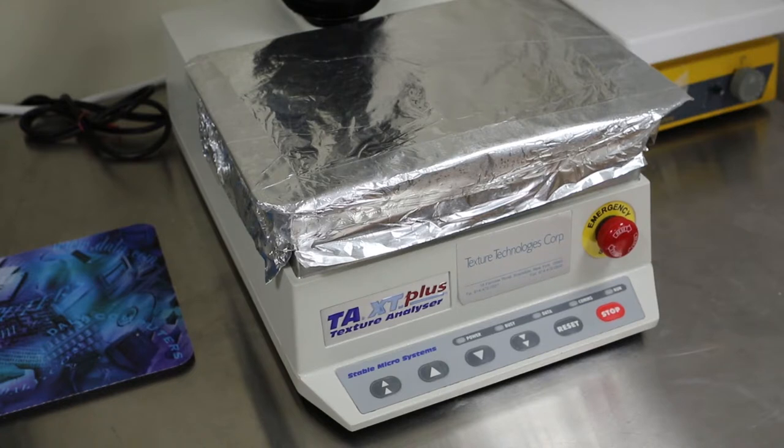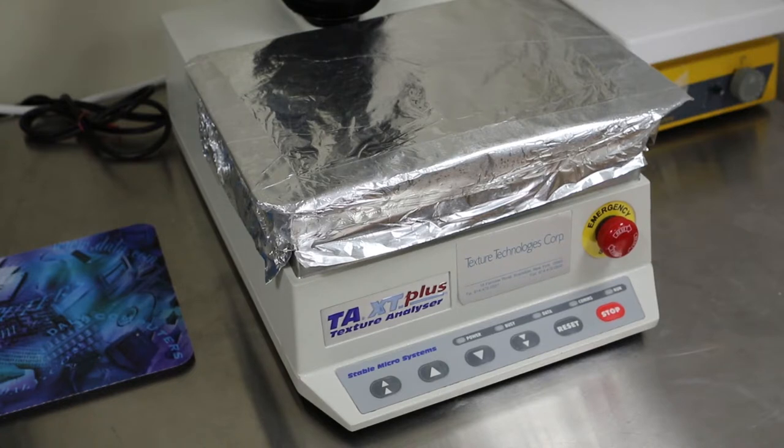We train them on a texture analyzer. The way we use it is to try to relate what you might experience as a consumer when you are eating food, for instance, and how that experience translates into quantifiable numbers. And the texture analyzer is how we use that.